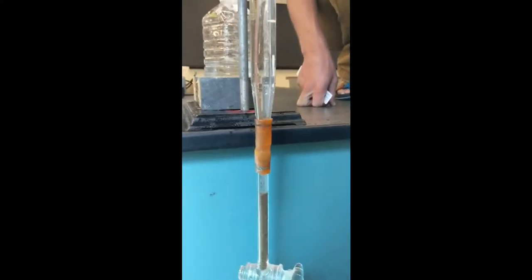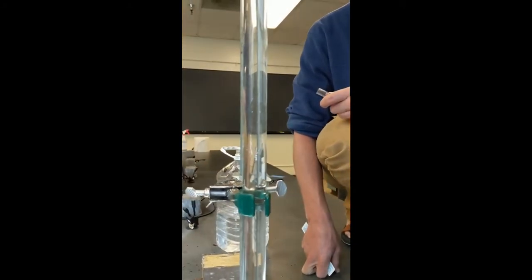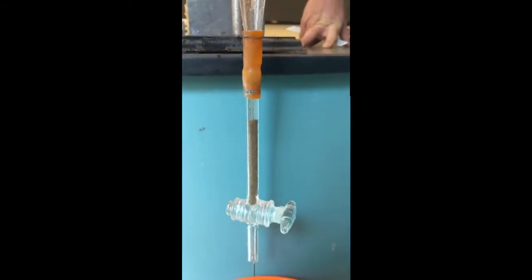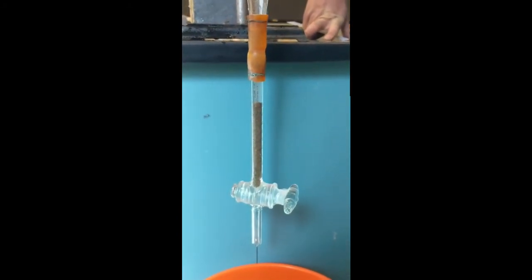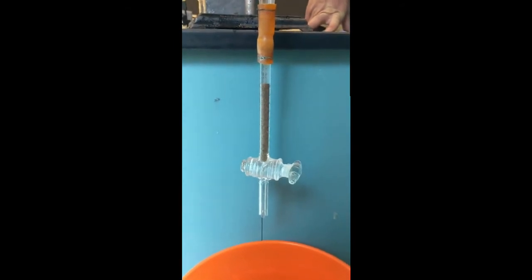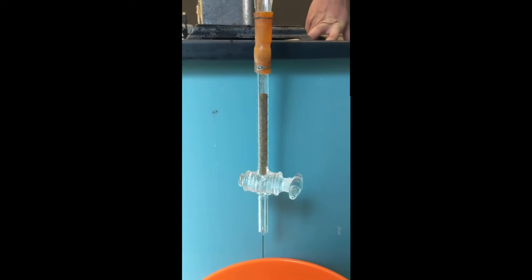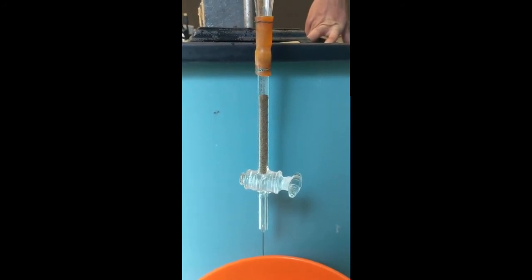And then eventually, if we wait long enough, all these little particles of mud and silt, the very, very fine particles of sediment, gravity is going to make these fall all the way down to the bottom, and we're going to record their height as well. Okay, so that's just how this works. We're going to compare this sample of mostly sand from a local beach to a sample from the bay where there's a lot of mud in the sediment.